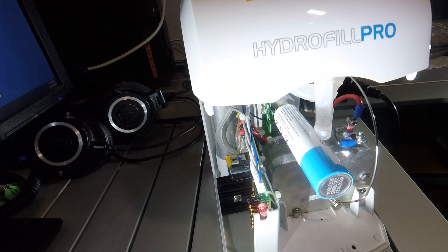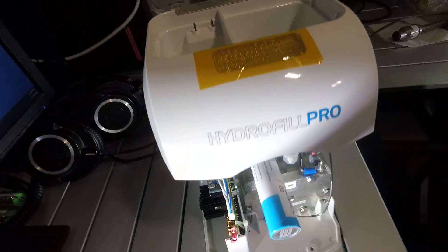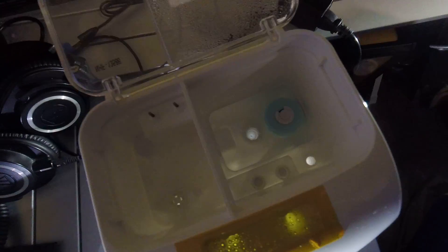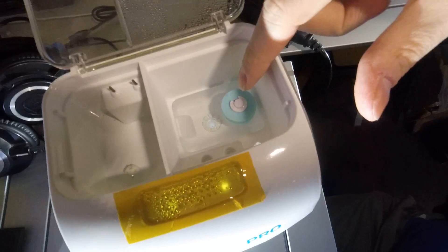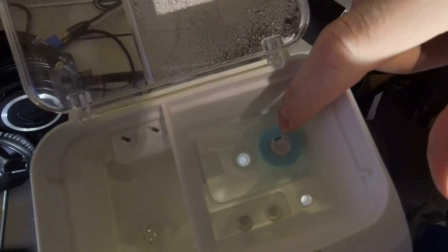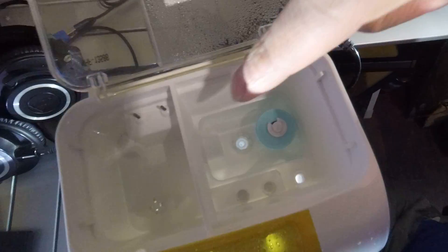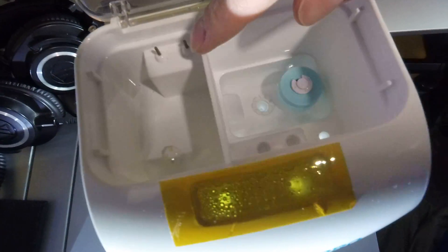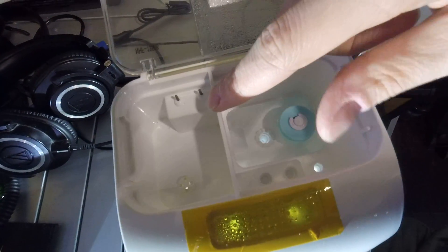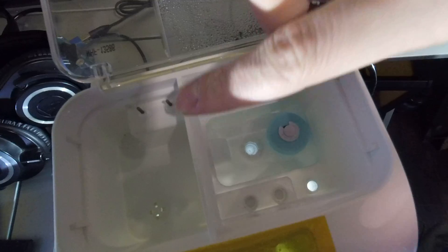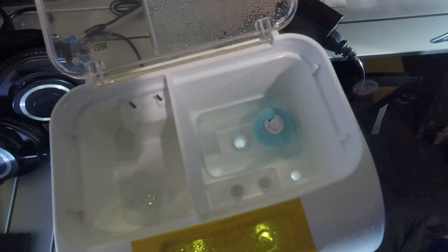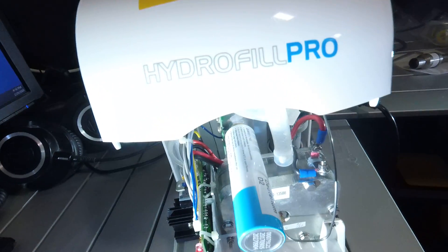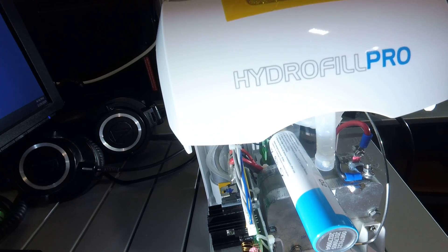So looking up at the top, I'll show you what it looks like in the tank. So here is the reservoir. It has a little float switch. And then there is the waste water tank for any waste water that's ejected during the purging of the PSA column. Though I haven't seen any accumulate in there yet.